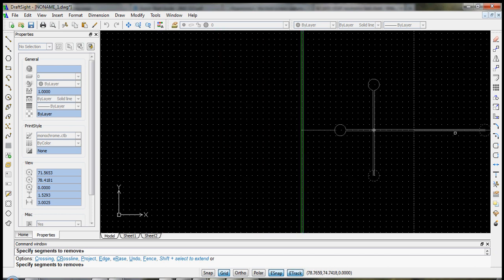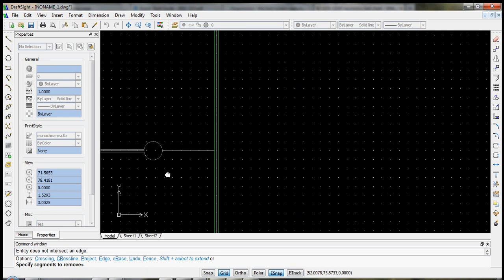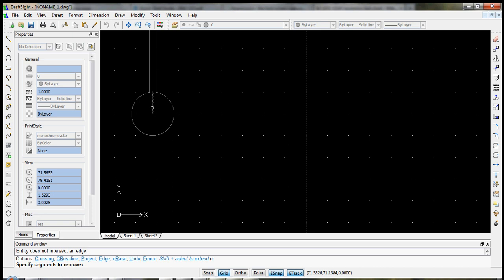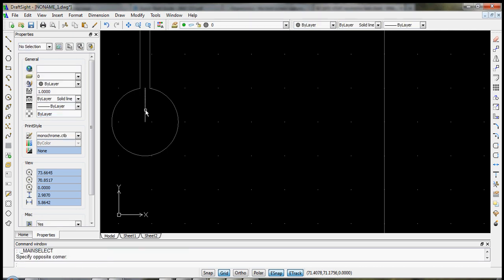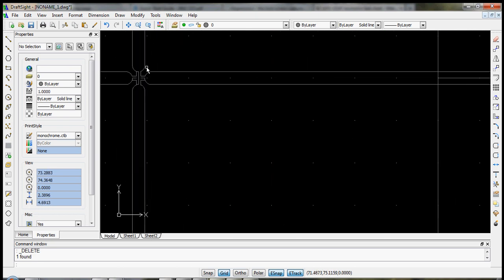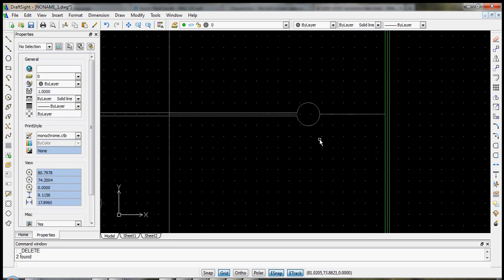Okay, let's see, we also have over here and this one at the bottom. Alright, as you can see, depending on the order that you do cutting, now this one there's no cutting line for this element, so we can't actually trim it anymore. But we can simply select it and hit delete, and do the same to clean up the middle here. Delete those, delete those. And now we're looking pretty good.